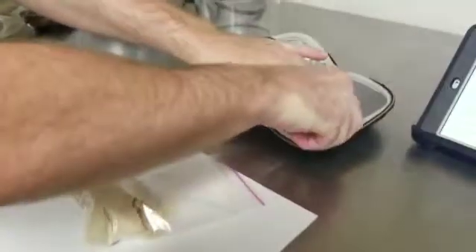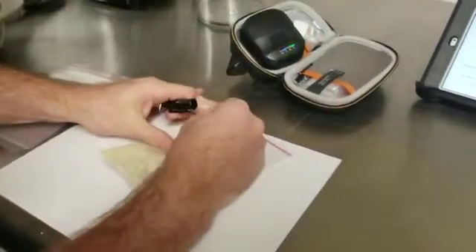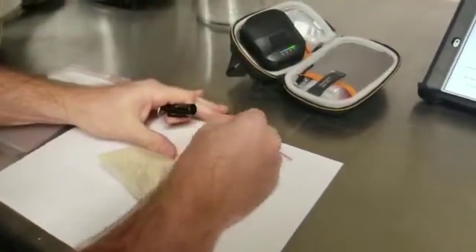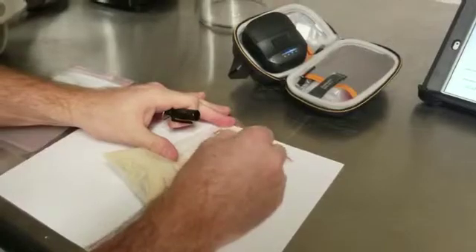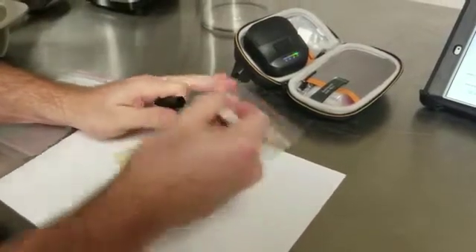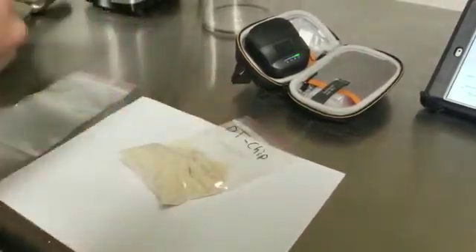We'll label this. DT chip. Here's our sample name.